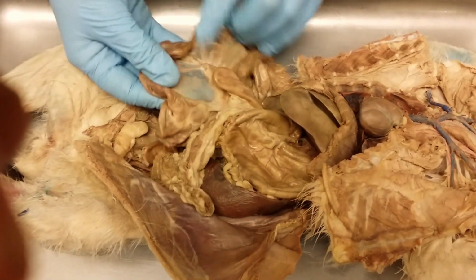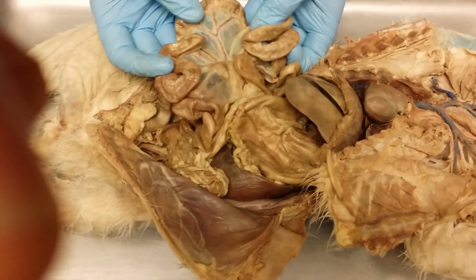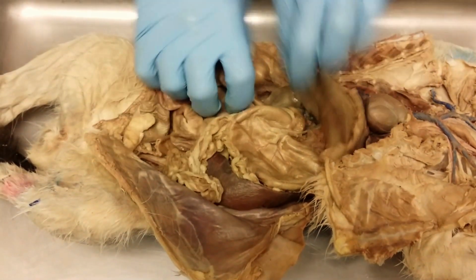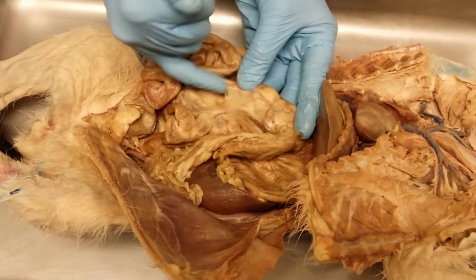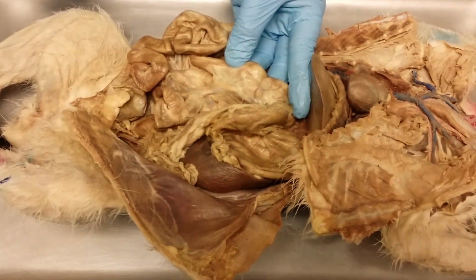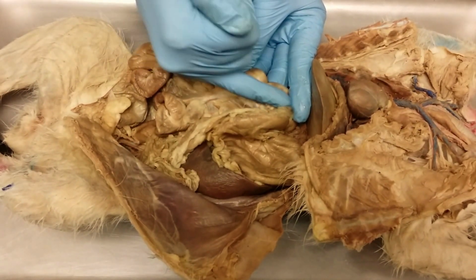And embedded in the mesentery, so the mesentery is all of this spider web stuff that kind of holds together the intestines. That's called mesentery. That's where all of the blood vessels and nerves will be embedded that supply the small intestines. So embedded in that mesentery, right below the duodenum, this grainy organ right here, that's the pancreas. Okay? Again, really close proximity to the duodenum because what did we say? It secretes its contents into the duodenum, so it makes sense that it's so close to it. Okay? So this is the pancreas.